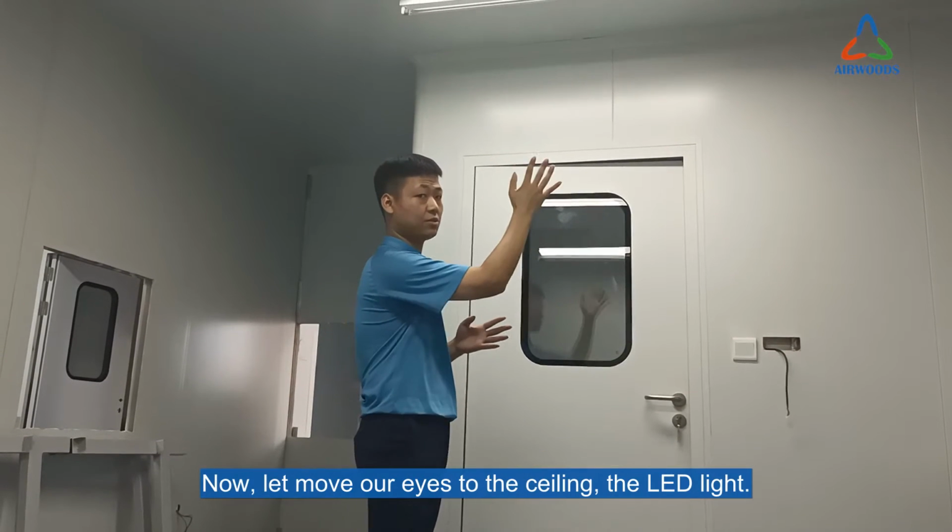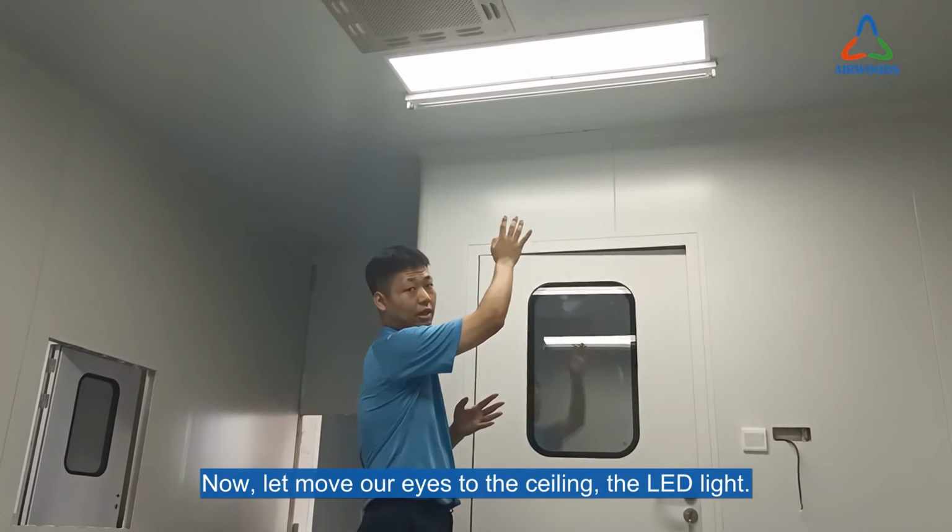Let's move our eyes to the ceilings. You can see there is the LED light.